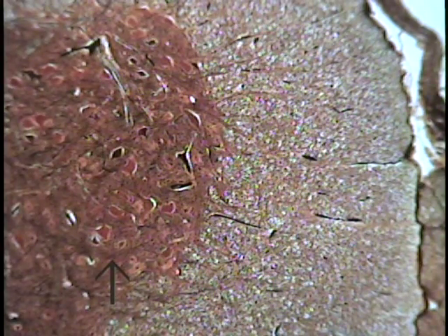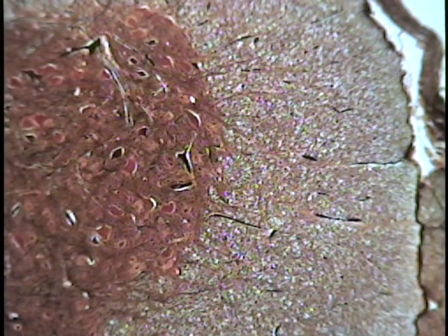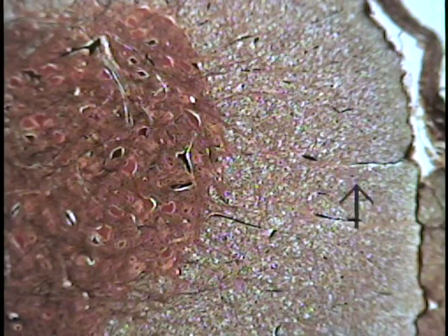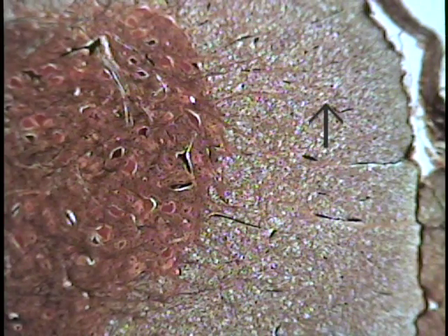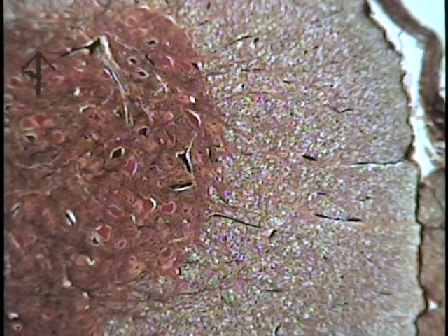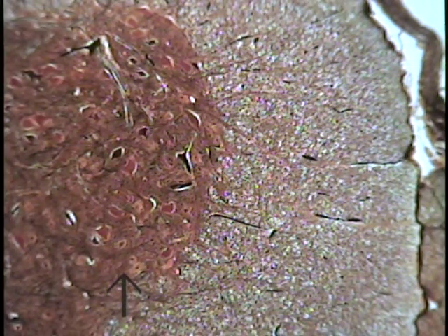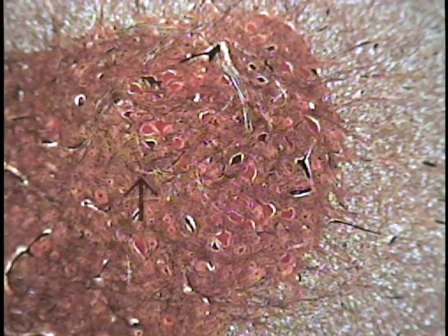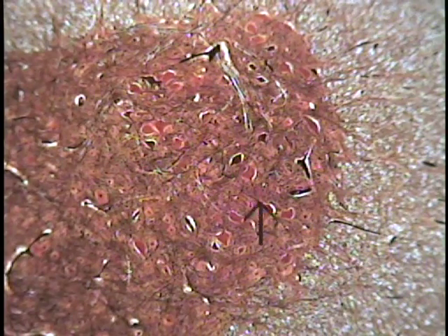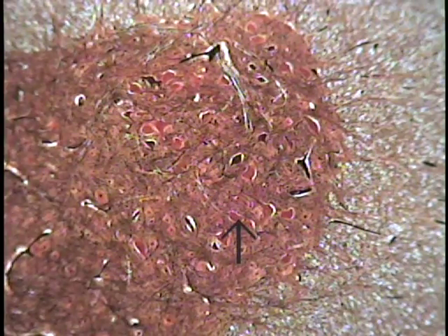Another excellent place to look when examining very large cells is within the spinal cord. This is a section of spinal cord. This large area here is largely made up of what is referred to as white matter. The place to look to identify very large cells is in the ventral horn of the gray matter, which lies at the interior of the spinal cord. Even with the scanning objective, these large irregularly shaped objects are large cells referred to as neurons — of the same size, if not larger, than the ova.